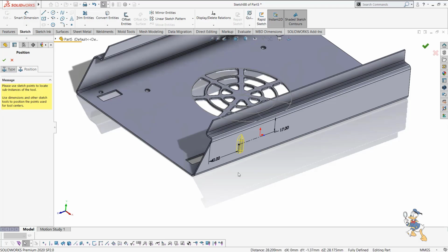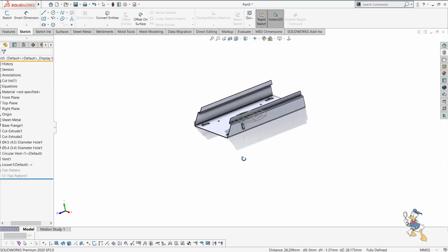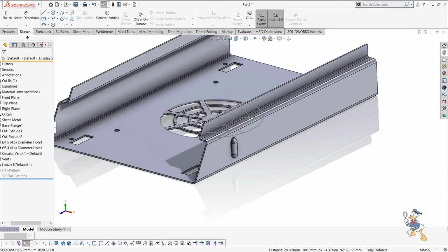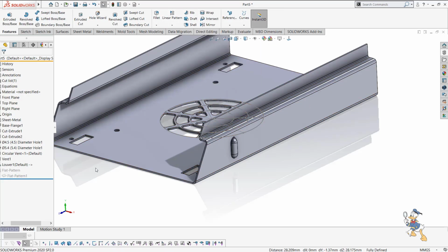So it is very easy to design this kind of stuff in SolidWorks, and it is very helpful while designing sheet metal components, because we struggle while designing sheet metal components, as we need to think about how we can design, and we need to concentrate on improving the design itself.